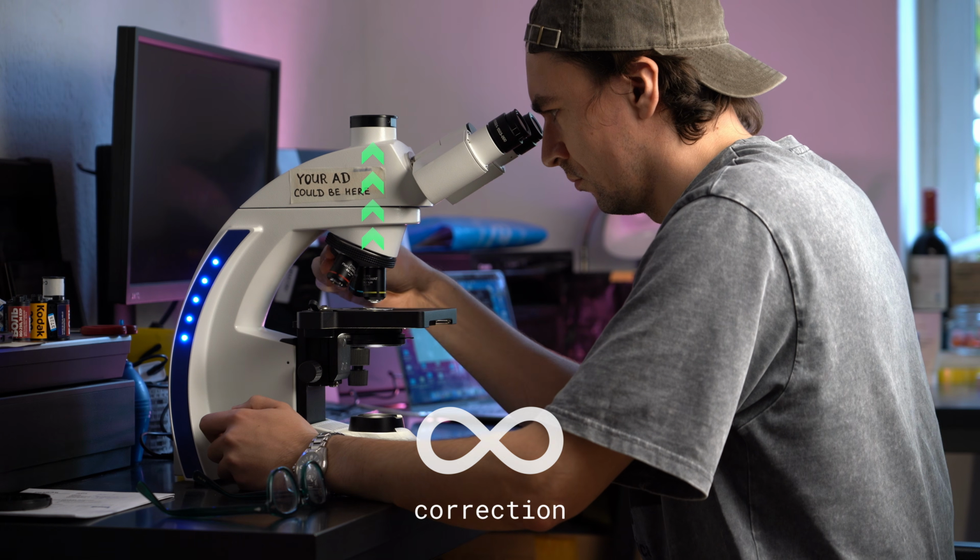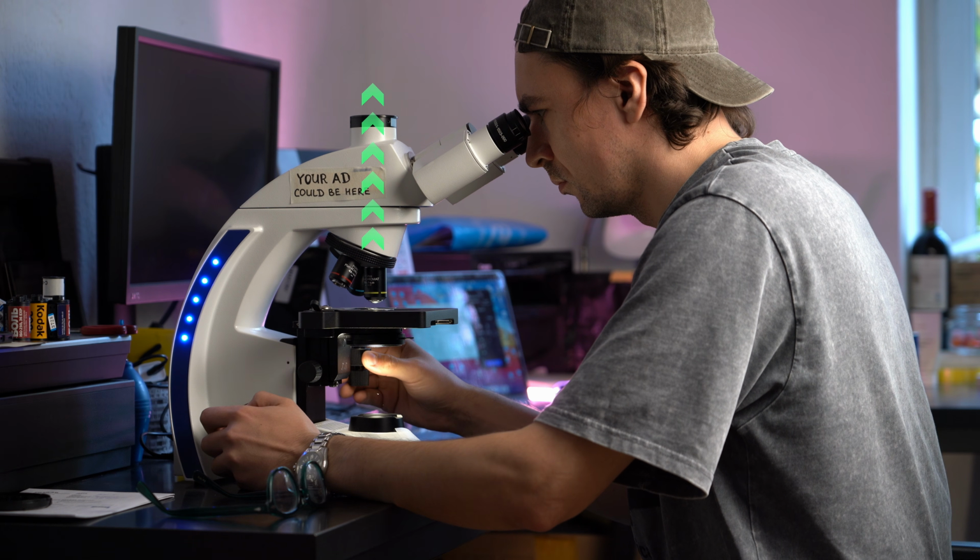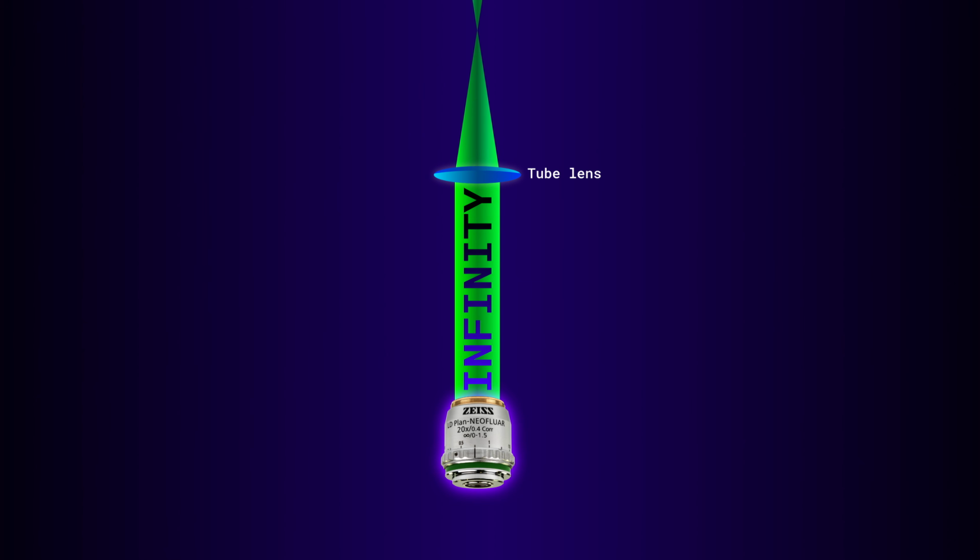That means that after the objective, the light travels as a parallel beam. And that's great for us, because it allows you to place all kinds of components directly into the optical path, without any changes to simple bright field image and overall microscope performance.